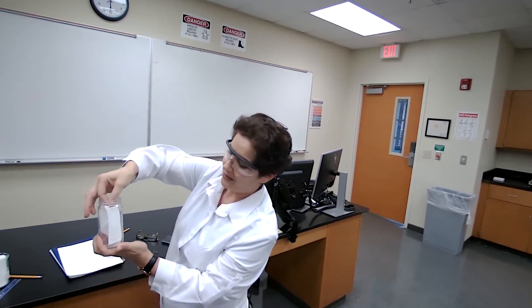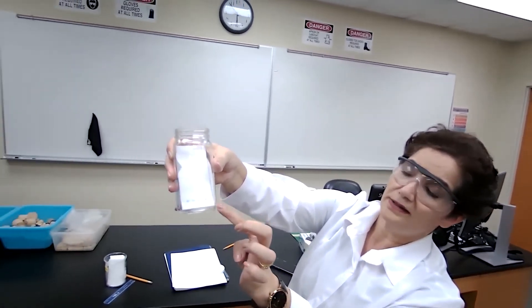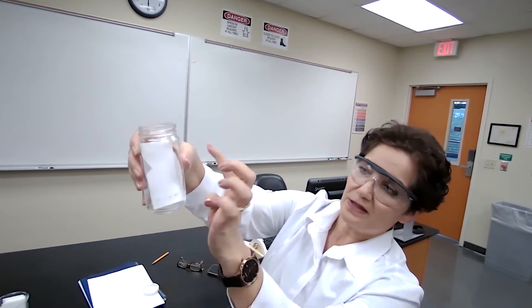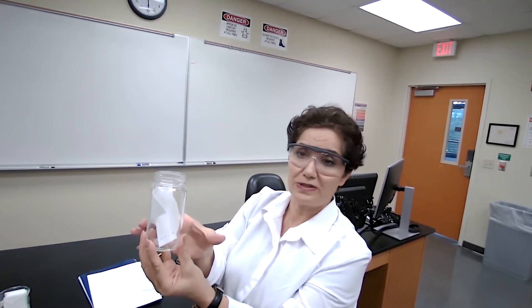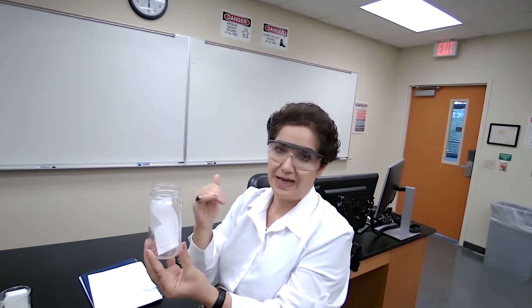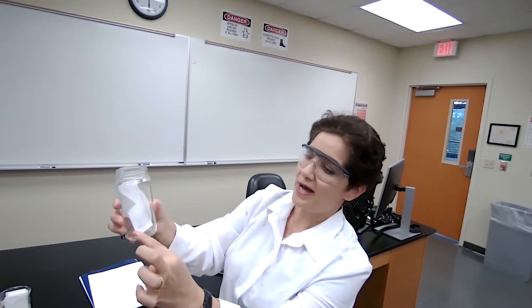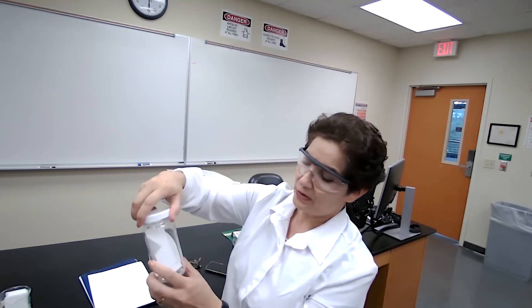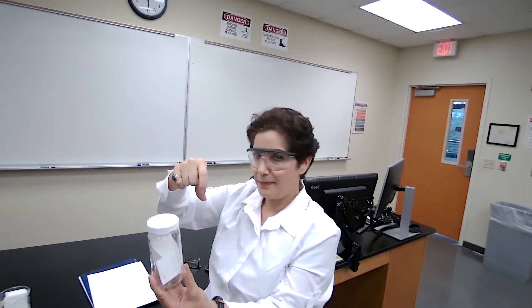When you place the TLC plate inside the jar, make sure the level of the solvent is not higher than the sample line — it has to be lower than that line. Based on this setting I suggest 10 milliliters of solvent, but if the jar you're using is wider, that volume needs to be adjusted. As long as the liquid covers the bottom of the plate but does not reach the line where your samples are. After placing the TLC plate, the solvent goes up via capillary action — the same way liquid moves up a capillary tube.